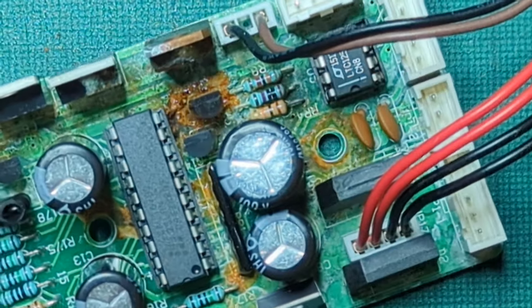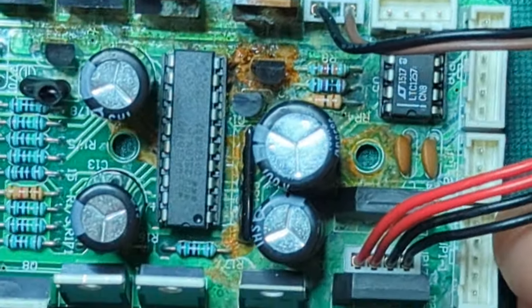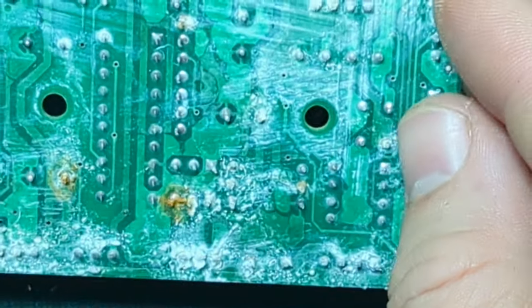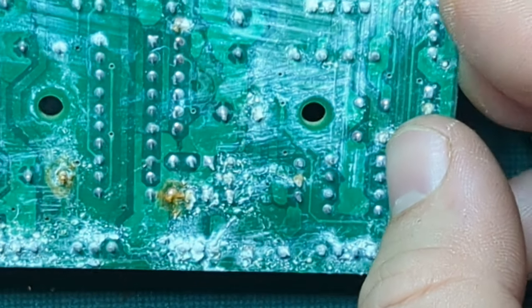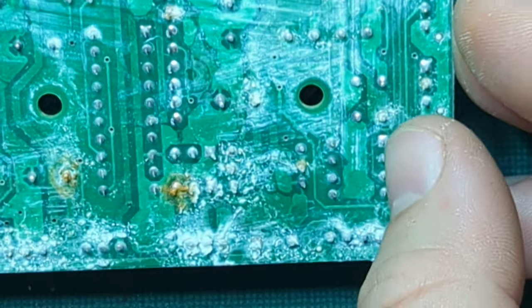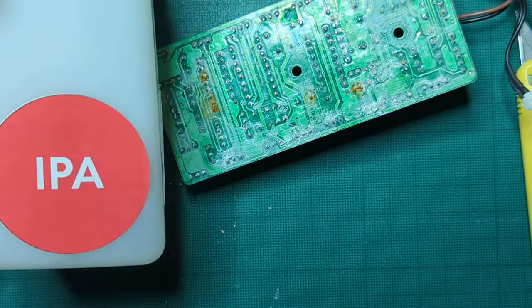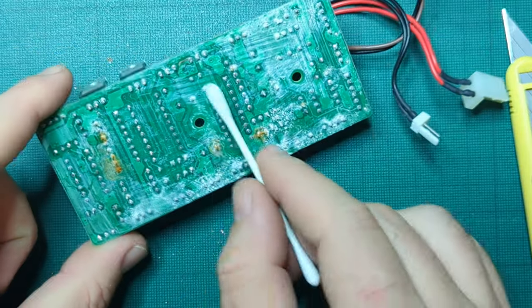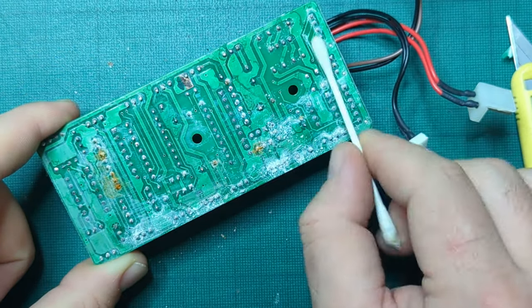This looks really bad. Under magnification, I can see just how much damage there is. And to be honest, I'm thinking I've wasted my money here. But I guess all I can do is keep pressing forwards, and so I'm going to give everything a really good clean, try and get some of that rust out, and hope that with some isopropyl alcohol and a bit of time, I might be able to save this board.